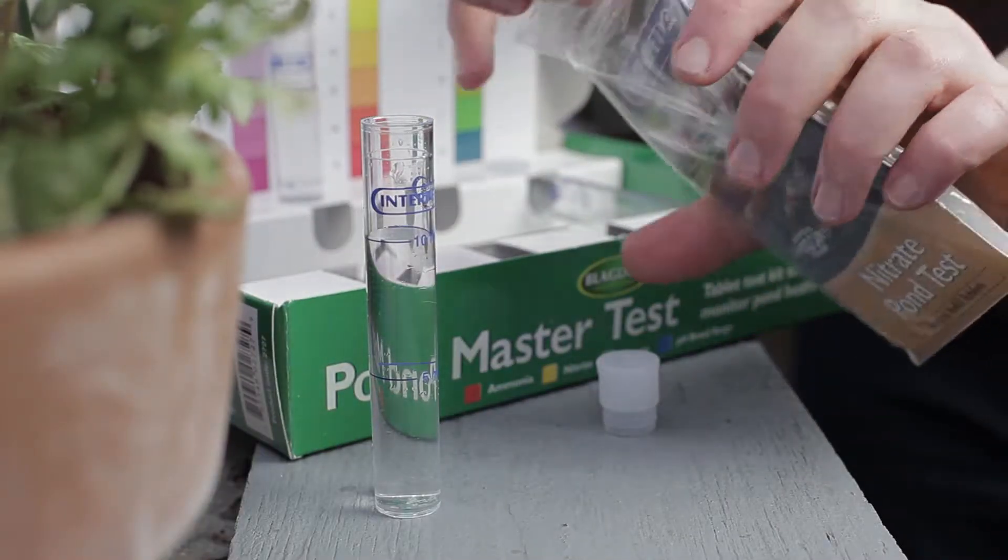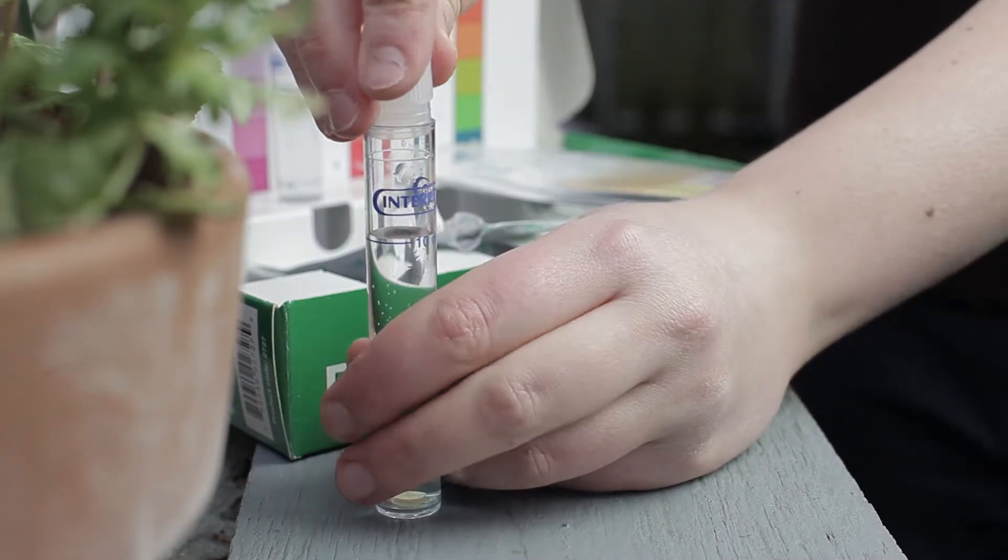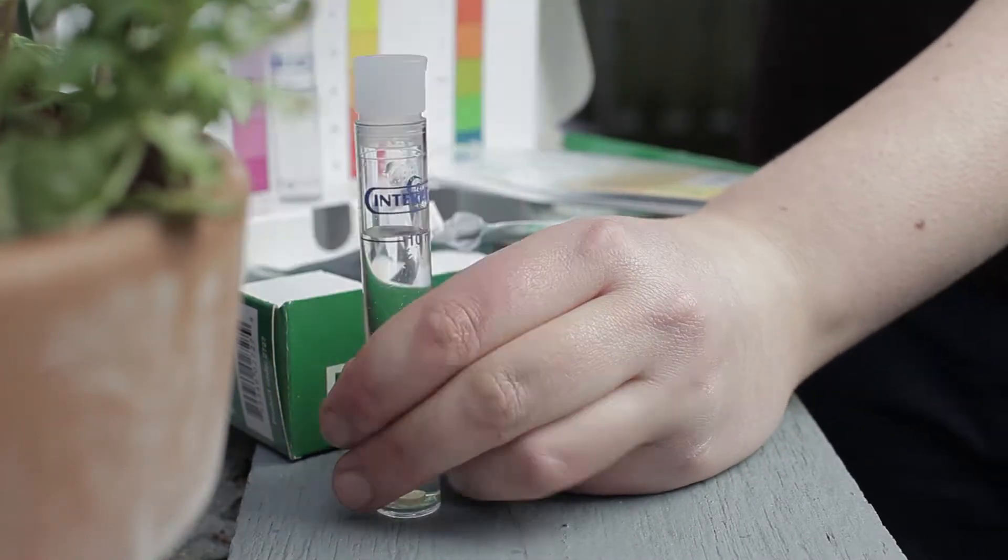Add one Nitrate 1 tablet. Cap the vial and shake vigorously to help the tablet dissolve.